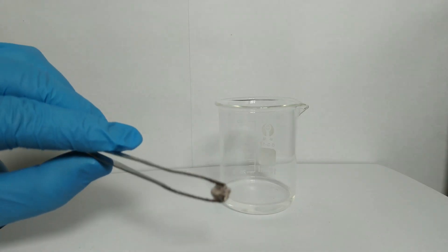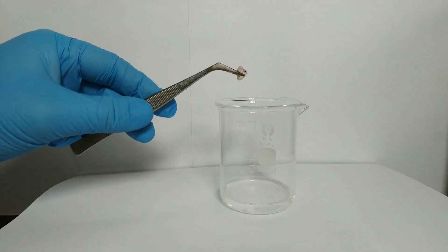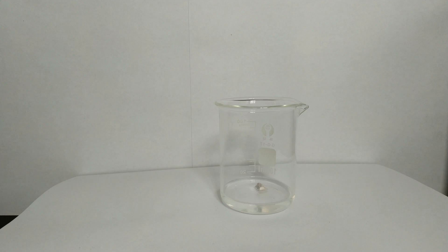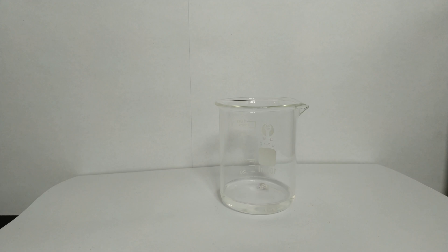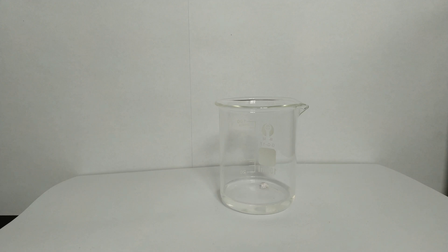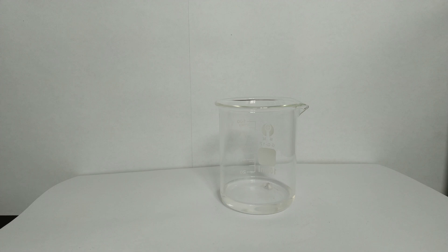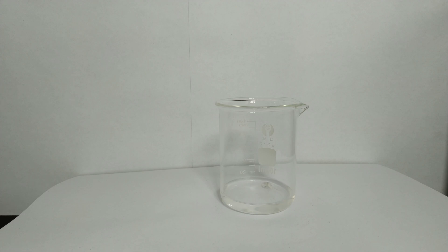Greetings! In this experiment we'll find out how sodium reacts with absolute ethanol. The emerging products of this reaction are sodium ethoxide and hydrogen.